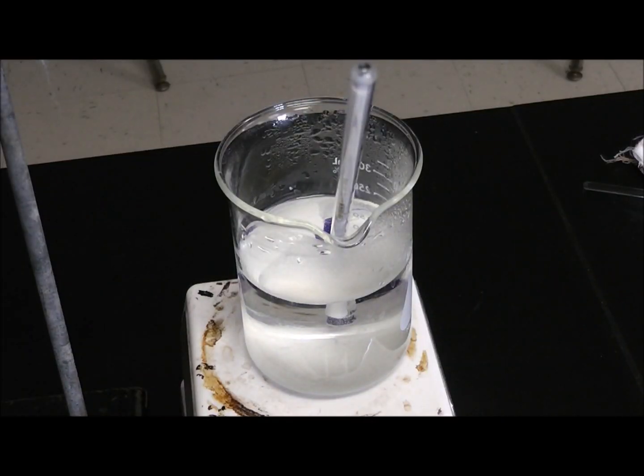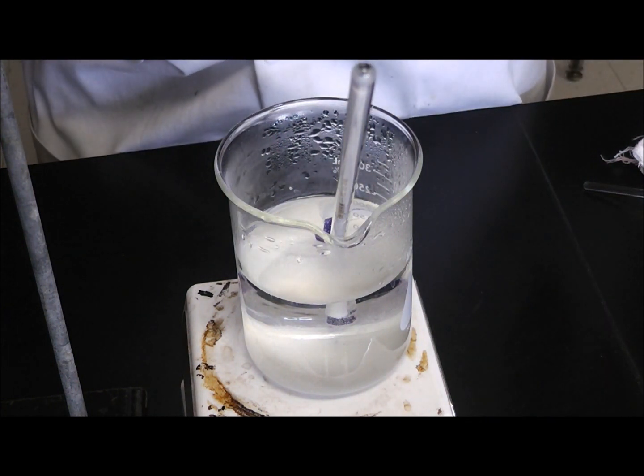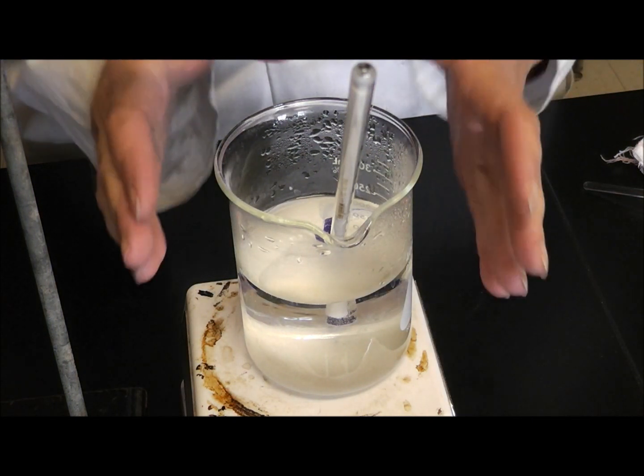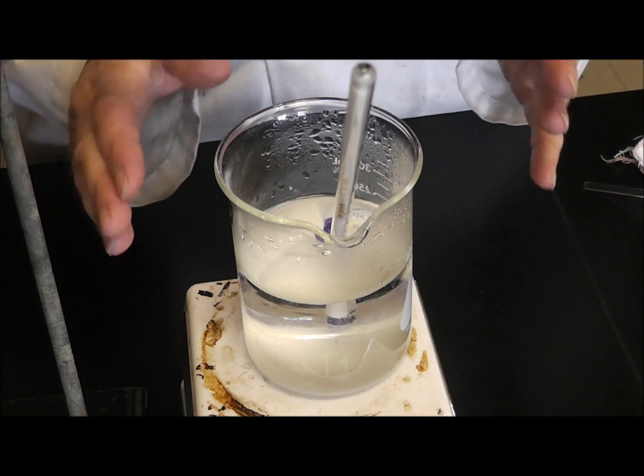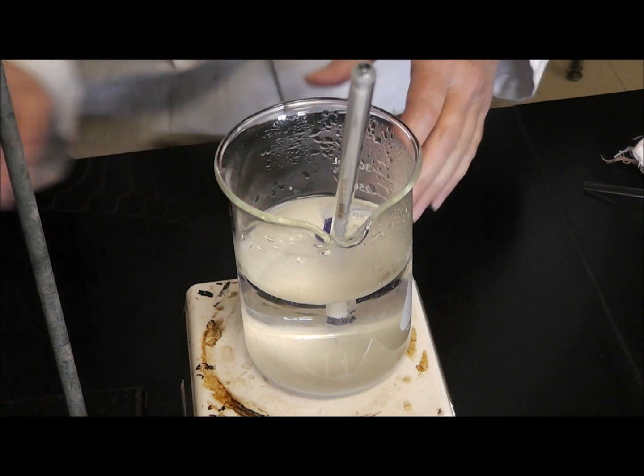All right, so this is the lab, the aspirin lab, which is the final lab in AP Chemistry. I have my water bath. It is at about 68 degrees and it's at 2 on the little knob.